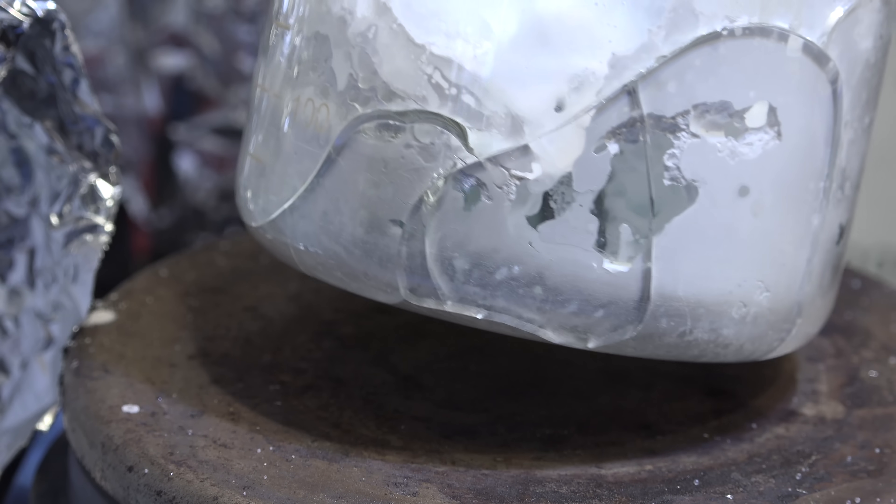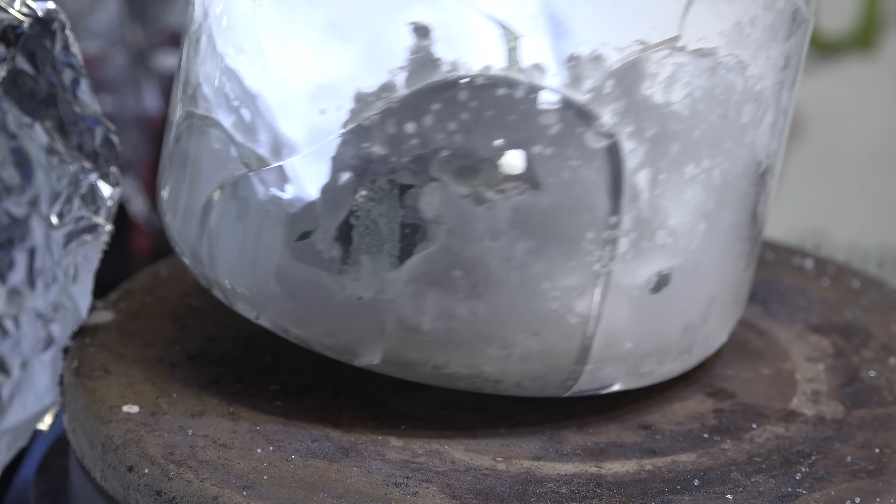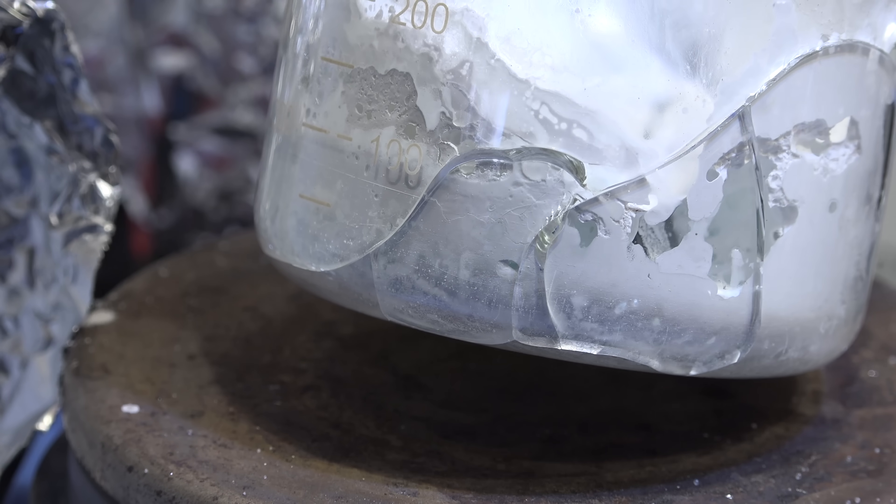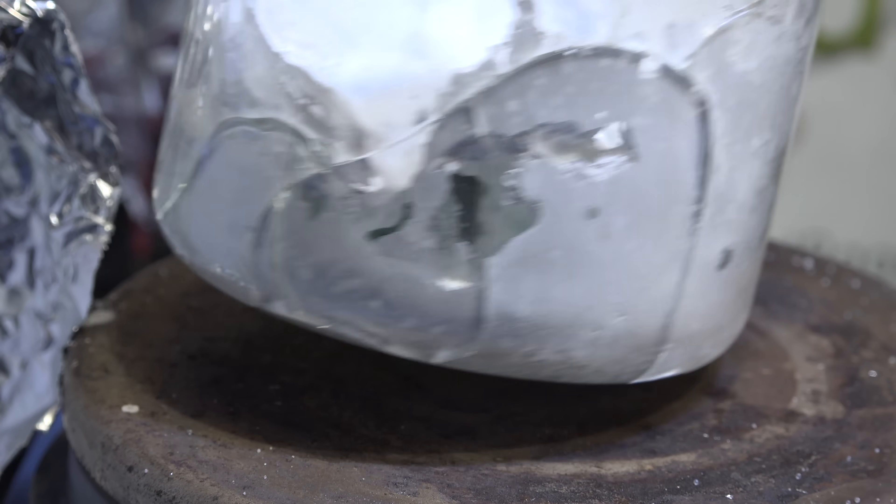This isn't surprising actually. Sodium silicate is well known for being part of many types of inorganic binders, cements, and other adhesives. I'll probably explore that particular chemistry in the future.